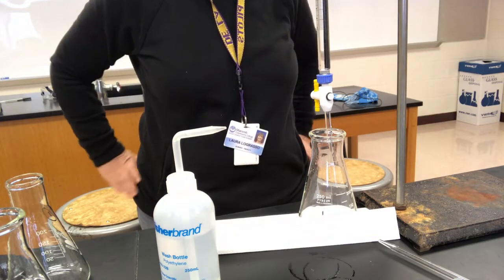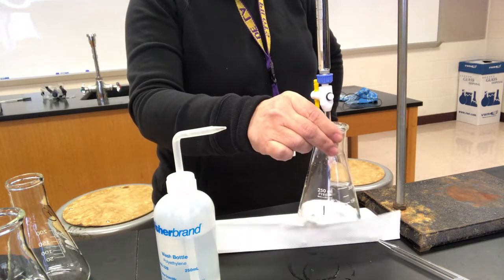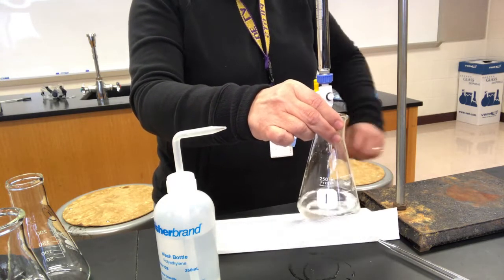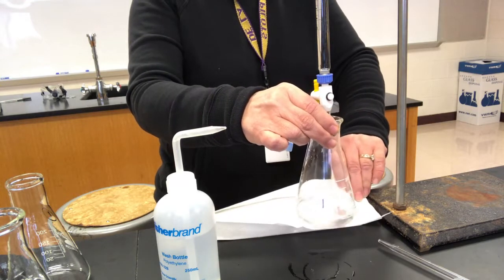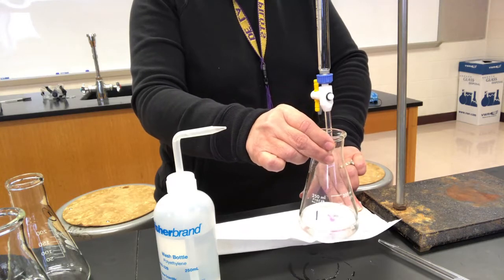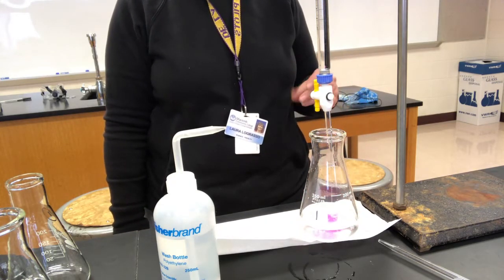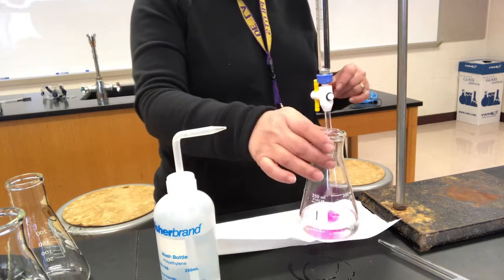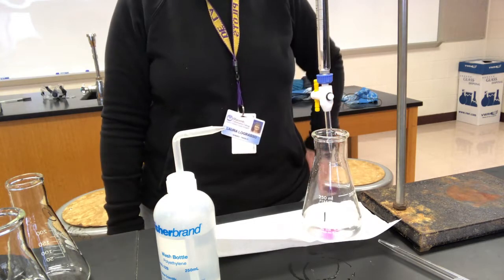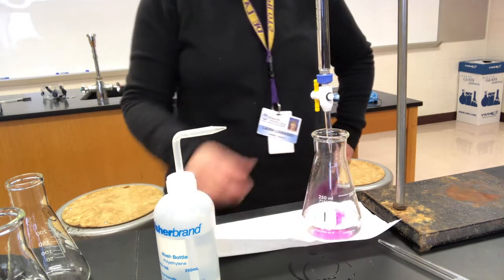and we're not going to go over as long as we stop before our calculated number. And you can see that it's turning a little bit pink, and I'm not letting that worry me. If I swirl a little bit, you see that the pink goes away. You see the pink? And it goes away when I swirl a little bit. Probably should watch the volume. It's down at 17 now. And it's going down, down, down. Do you have that number in your head? Did you calculate it? So you're going along. I will stop it fairly soon.